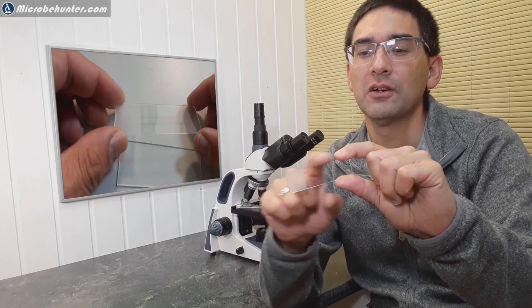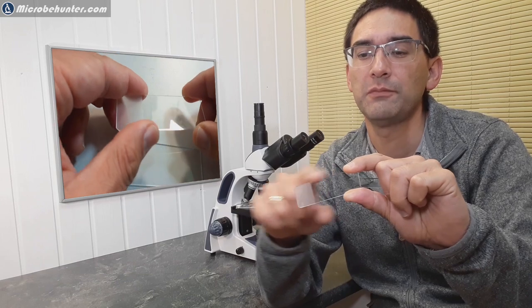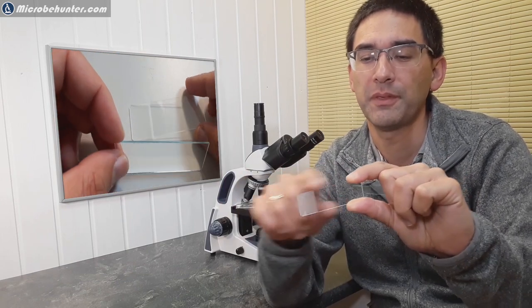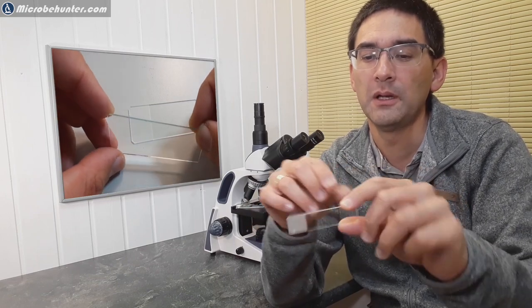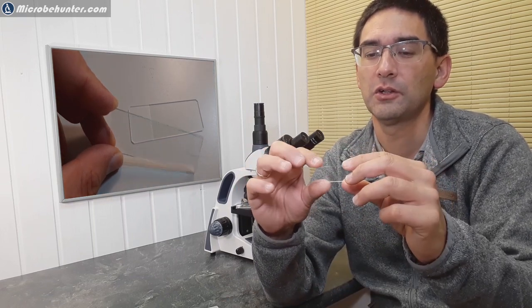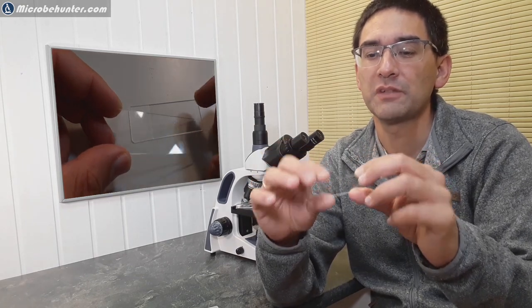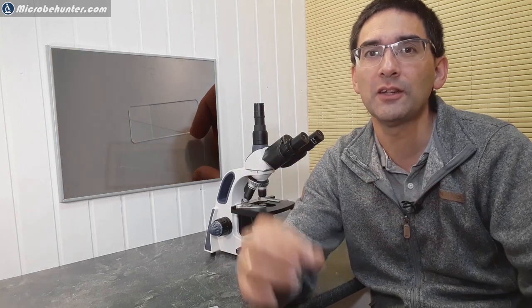And also the sides here, they are basically kind of smooth and they don't hurt you because they've been, also I guess they used some kind of sandpaper or something, also to make this a little bit, the edges less sharp. And those slides here, you can see that they're quite sharp. And there's the danger of the slides chipping, of course, especially if you stack several of them on top of each other. And this can cause injury.